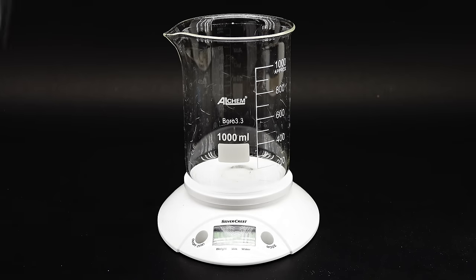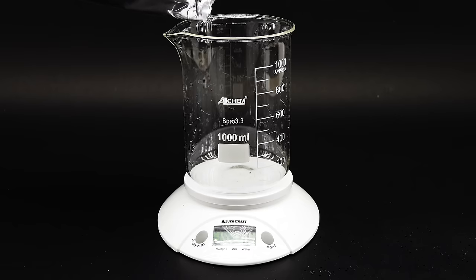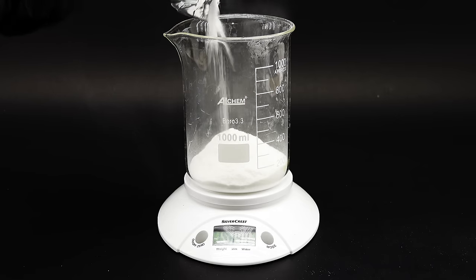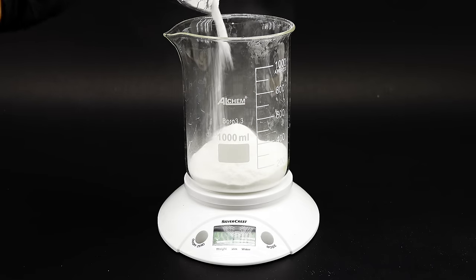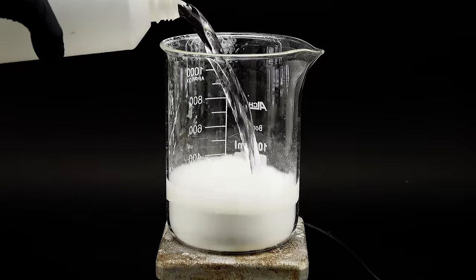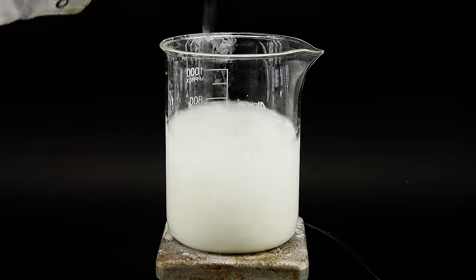Next, I needed to prepare the other solution of ascorbic acid, and to start, I weighed out 250 grams of it, and it was quite weird to use so much of a food product for science. Anyway, similarly to the copper sulfate, I dissolved everything in roughly half a liter of distilled water with strong heating.